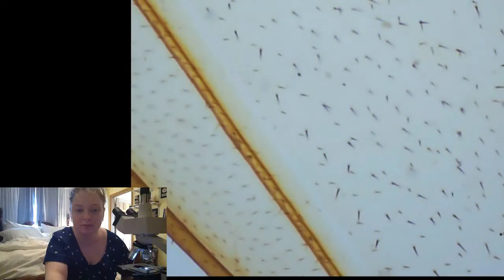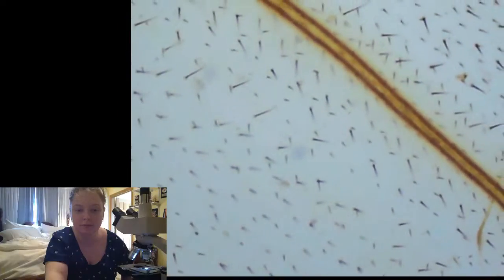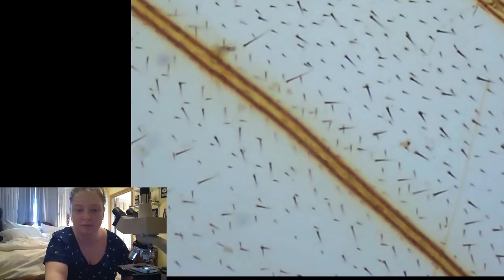Let's look at a bee wing next. I love bees. They are super cool, and I want to save bees. Also, I really want to have a beehive. Once I started a bee garden, where you have special flowers that bees like. Oh, this is cool because it's kind of yellow. And it has fuzz on it. Check that out.